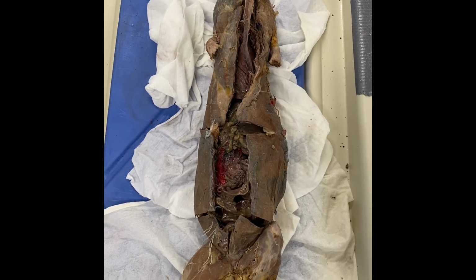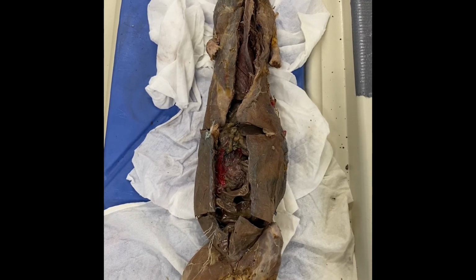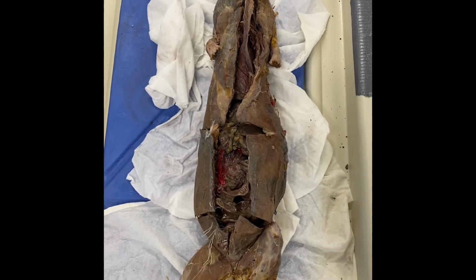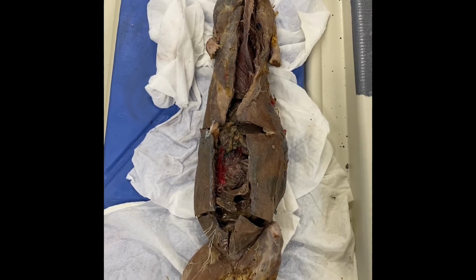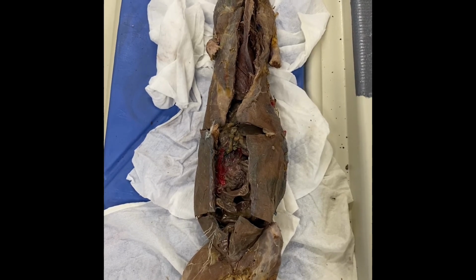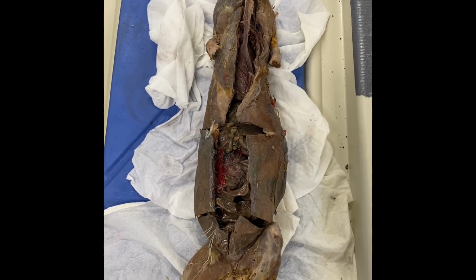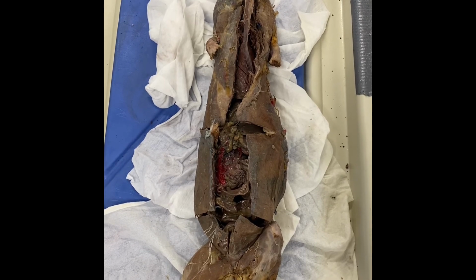The function of the teeth, the premolars, the canines, and the incisors is to tear and crush food. The esophagus moves food from the pharynx to the stomach, and the stomach is what stores, breaks down, and digests food. The duodenum is what processes the digested food and stomach acids. The liver and its lobes regulate bile and waste. The gallbladder stores and delivers bile to assist in digestion.